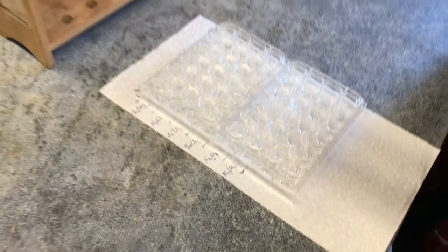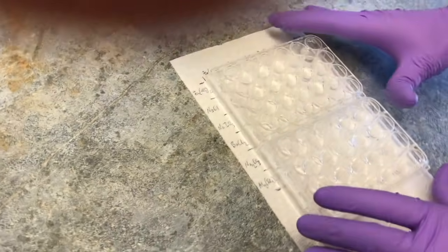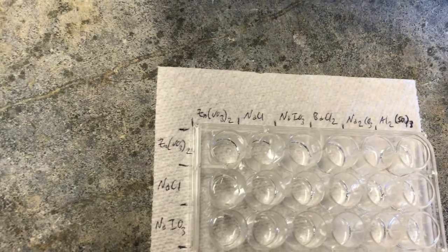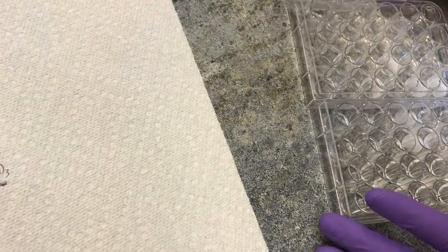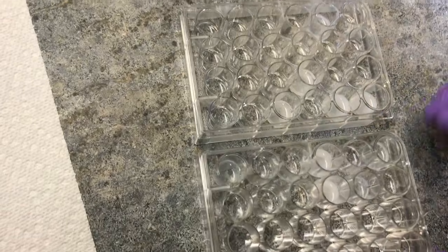And we're done, filling in all the wells, of course. So, get a top-down view of that. It'll be a little bit difficult to see. I only have this piece of paper towel just to keep everything in order so that I'm filling in the proper rows and columns. But if we remove it from underneath, you'll be able to see that there has been some sort of reaction where a salt precipitates out of solution.